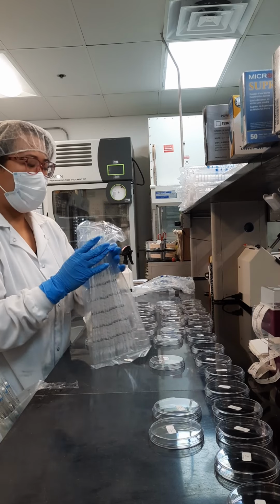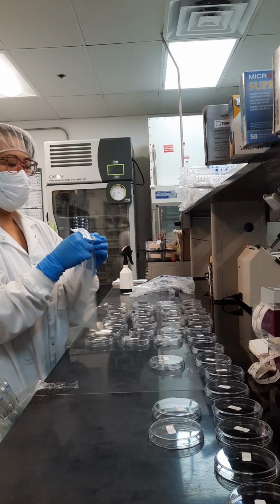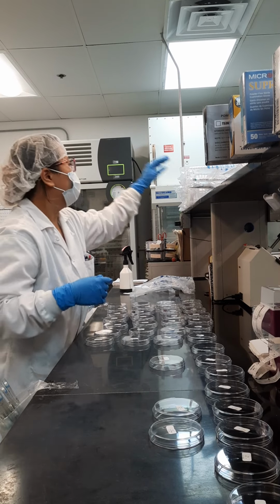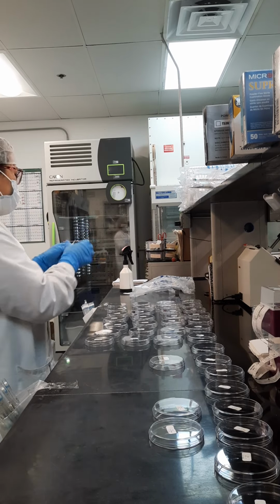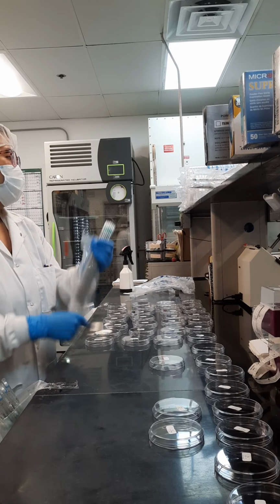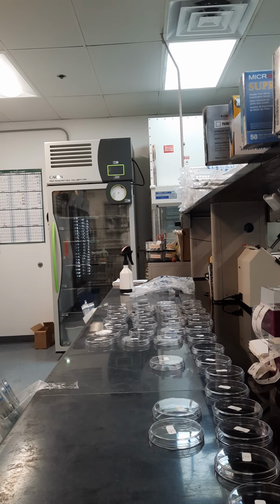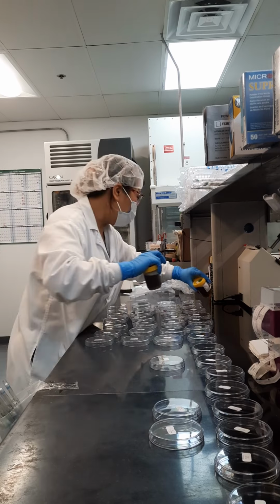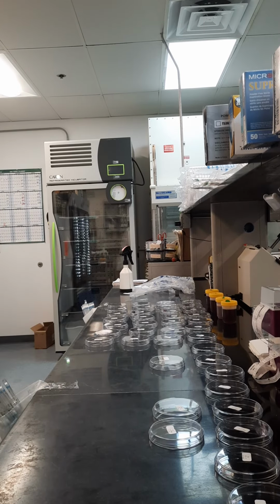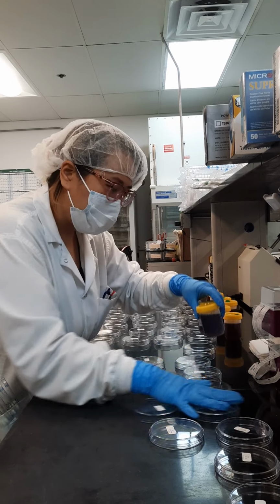This is aseptic technique. I wiped down the benches earlier with isopropyl alcohol. And aseptic technique being, you know, sterility, being able to make sure nothing's contaminated. Even breathing on the plate could give you growth, and you want ideally zero growth if the formula is good and the testing is done correctly. Just matching up my plates to my cups.